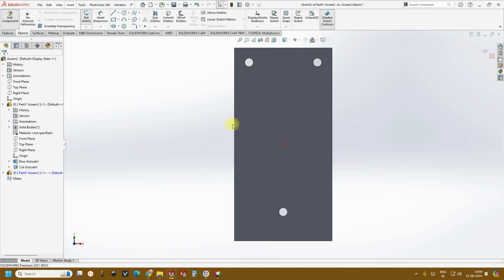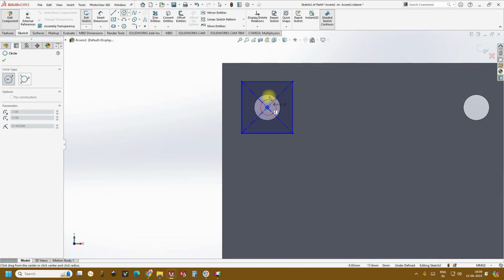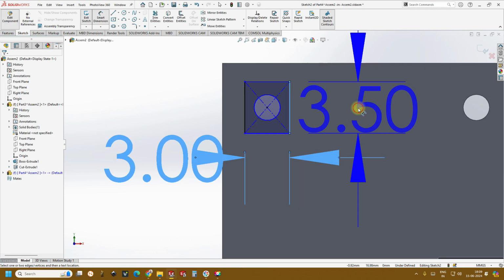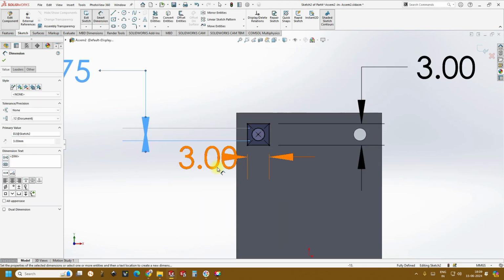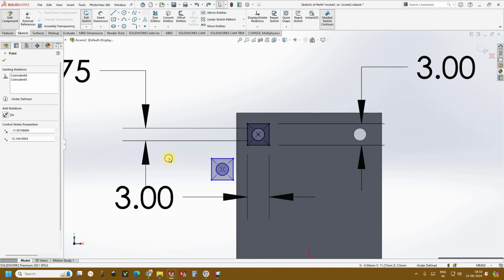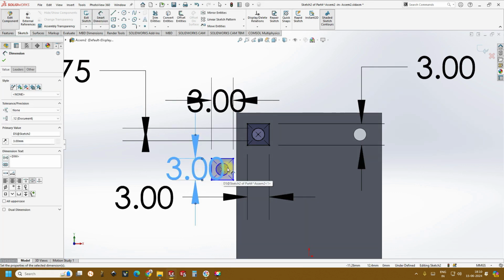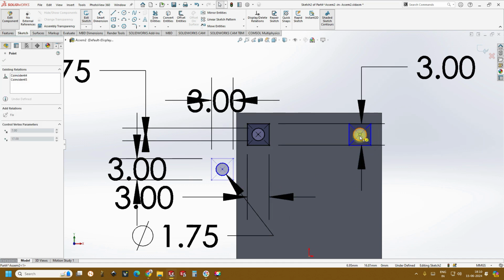And click on this, create another sketch, and same here, let's create a center rectangle, another inlet, 3 mm cross 3 mm. So these are the pillars to give support to the inlet and outlet. And once you have created this, you can just copy paste it, Control C and Control V, and now you have this. Okay, so before that, give the smart dimension, just press enter, so it is easy to pick quickly, we can do the dimensioning. So once you have done the dimensioning, just drag this and drop it here.